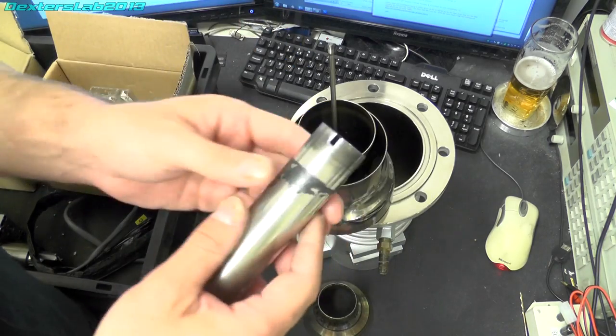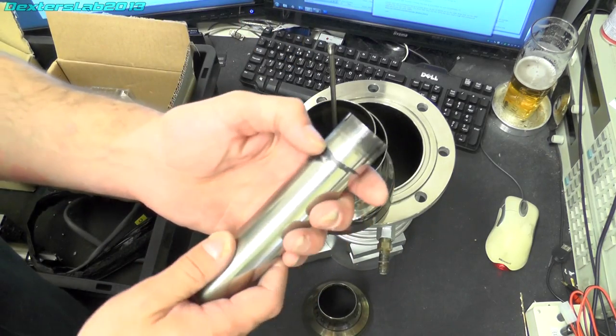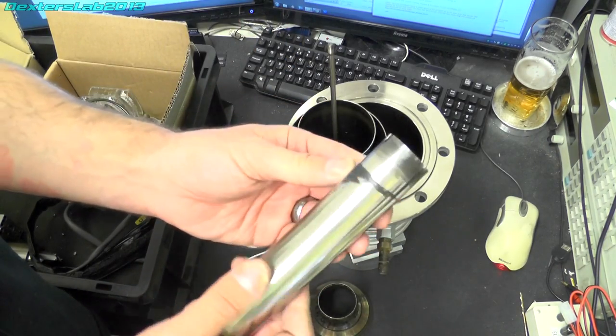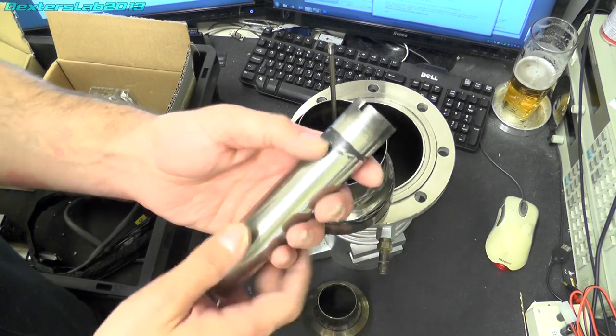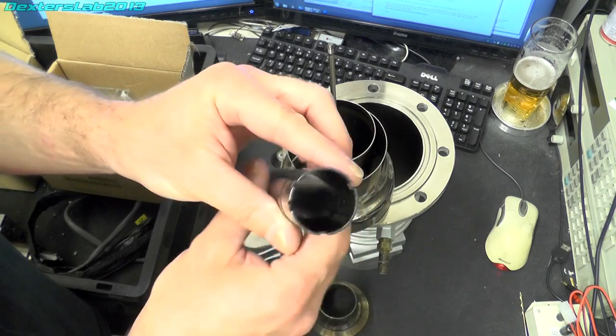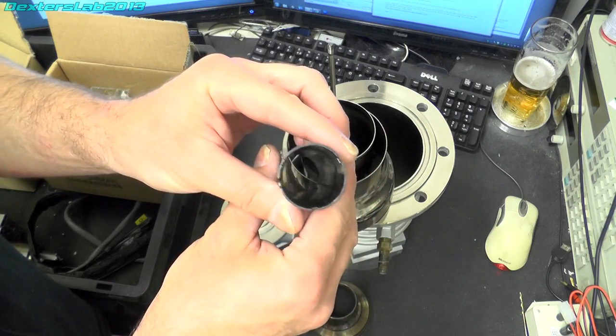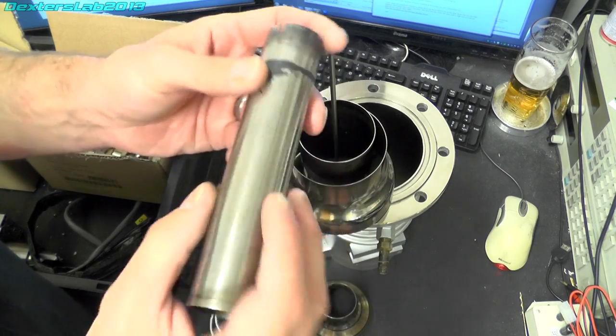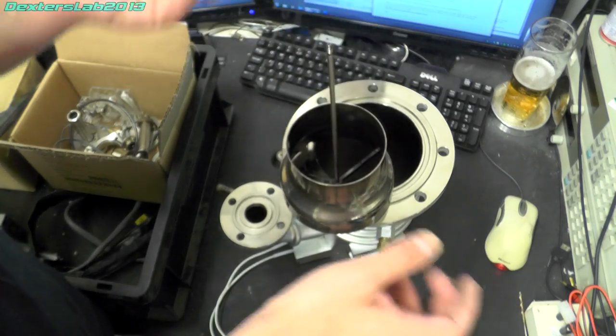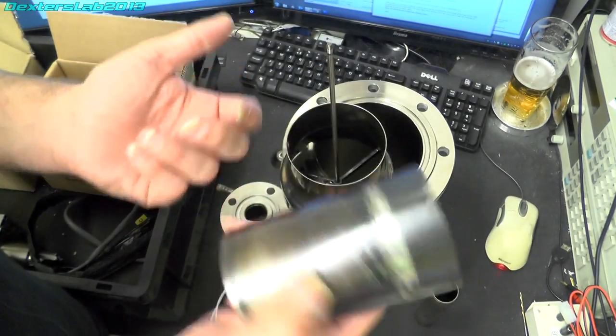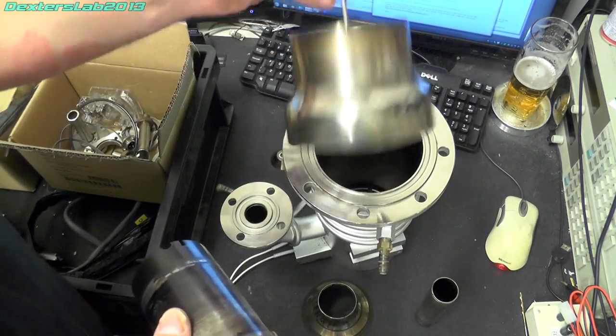Again here there was a load of the oil had completely carbonized around these parts. There's still a bit in the tube there so I'll have to get that out. So it all comes off in little bits.